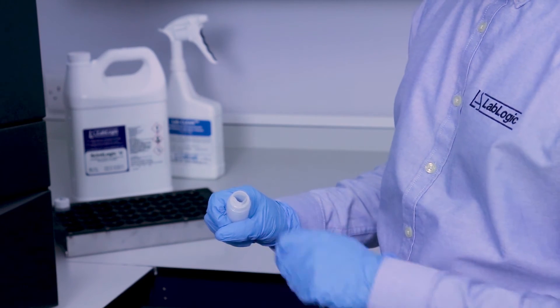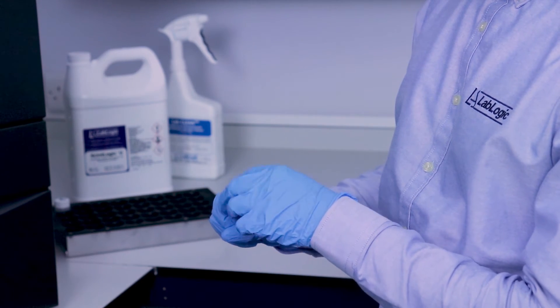Place in scintillation vial and dispense 20 ml of cocktail. We recommend Scint Logic cocktail since it helps dissolve the lab wipes, but any biodegradable cocktail will work.